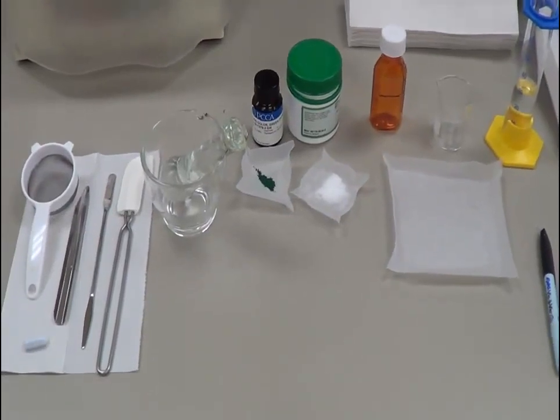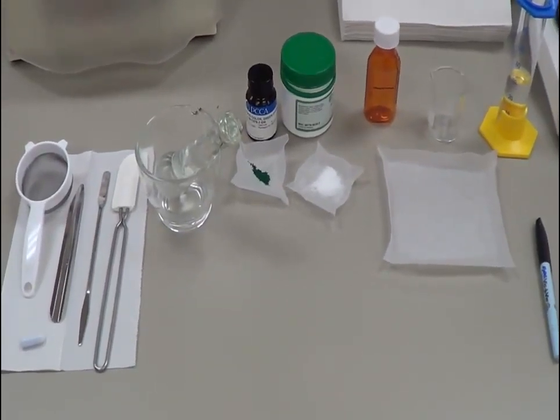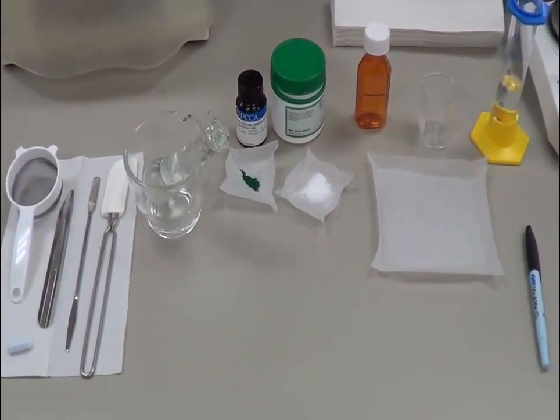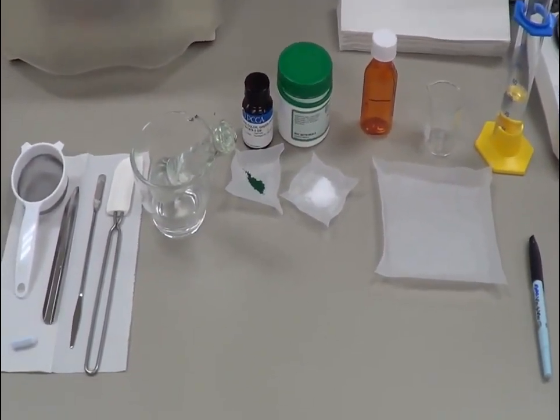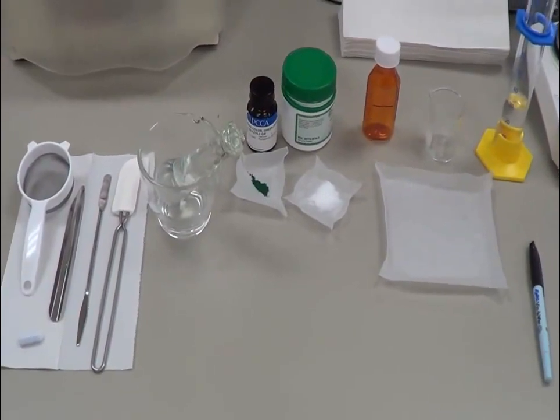Welcome back guys, today we are going to do a trituration drill. I am going to show you how to triturate the powder and at the same time we are going to perform a geometric addition.